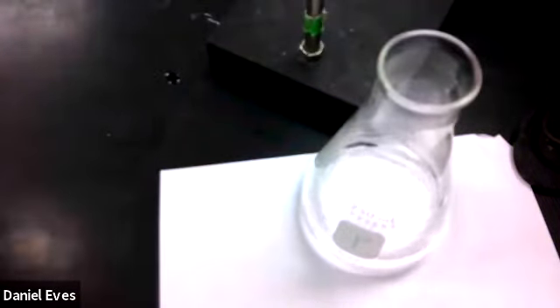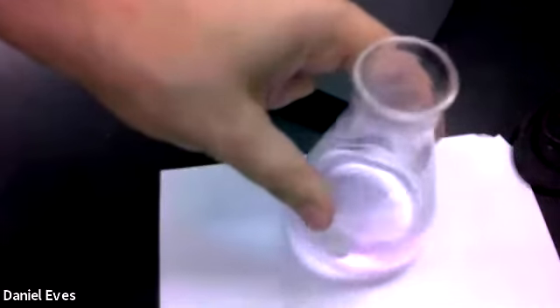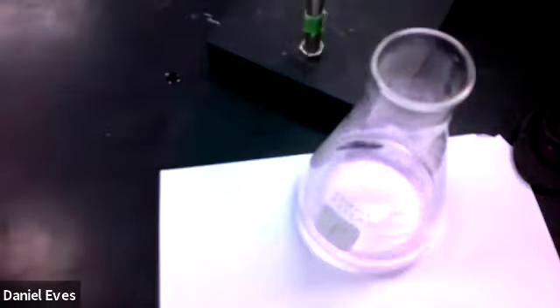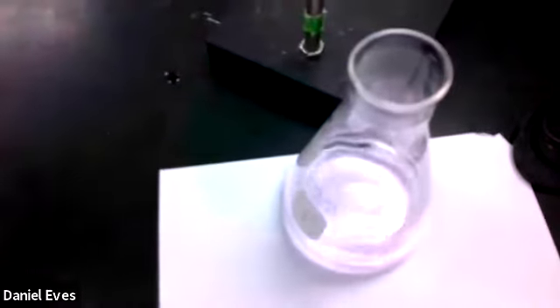I'm sure you've figured this out by watching me, but the closer you get to the endpoint, the slower you want to go, because if you're going fast, you may just zip right past it. Oh, looks like we're there. Okay, so let that sit for 30 seconds and see if we found it. Looks like, yeah, it's still that nice pale pink we're looking at. A little bit closer so you can see the difference.